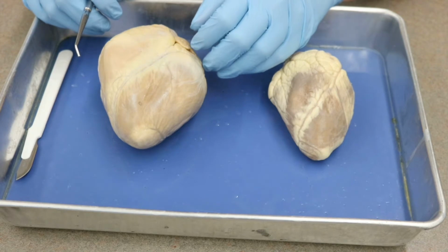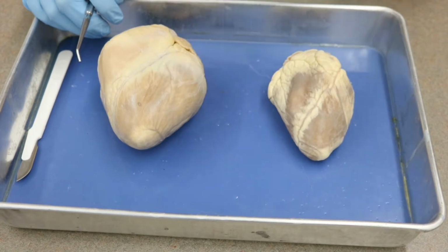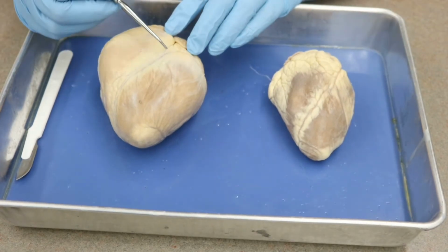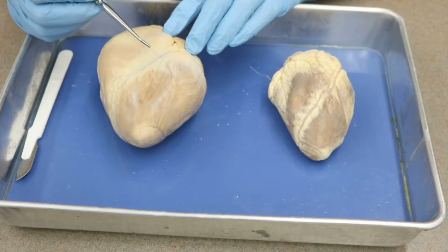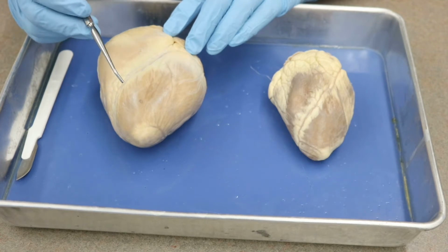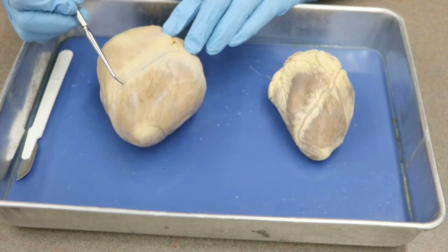So let's go with our sulcuses, or sulci. So just like in the brain, a sulcus is kind of the space. Remember, our gyri were the wrinkles, the sulcus was the space between. So the space here where our blood vessels would run, our coronary vessels, this is the anterior interventricular sulcus. Now that makes a lot of sense. So inter is between, interventricular, in between the ventricles. So our left and right ventricles, this is kind of in between them, and it's a sulcus.